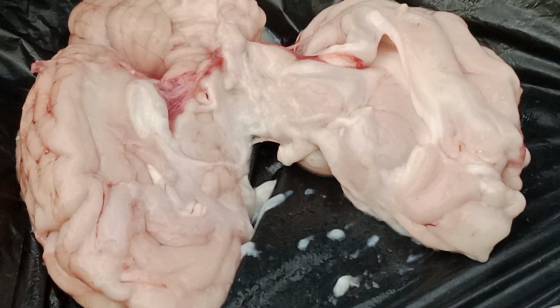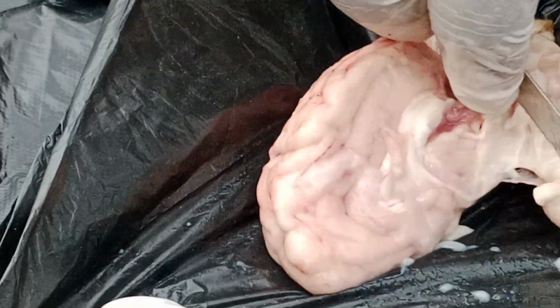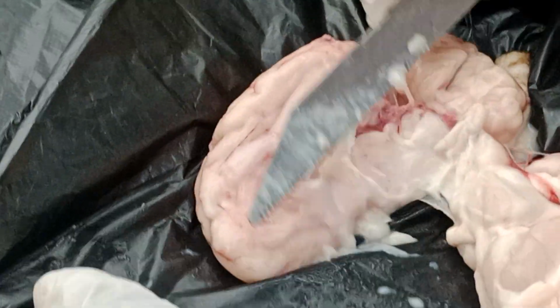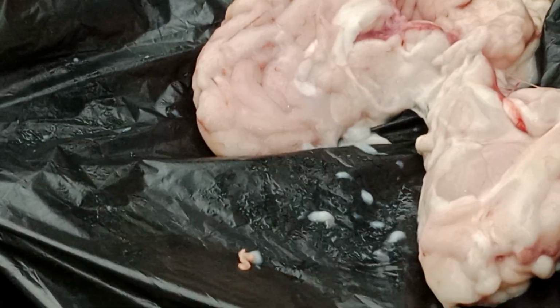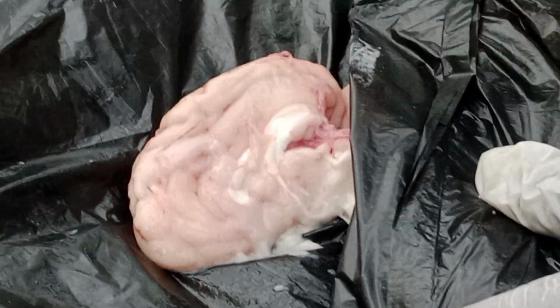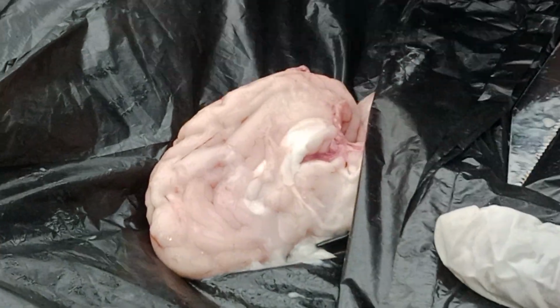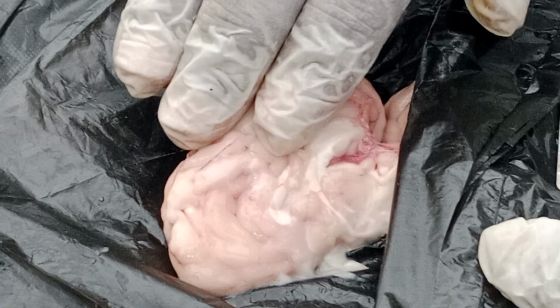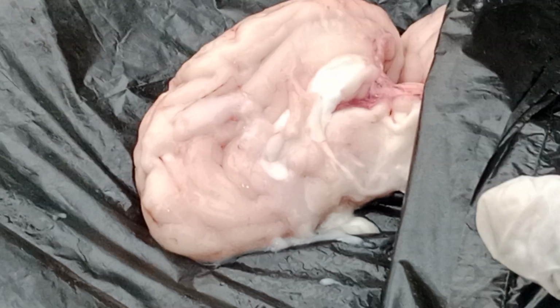See children, please observe this side only, where I am keeping the knife now. Leave out and forget about this side. It's not moving. It is sticky. Okay. I am hiding this portion for undiverted listening, so your concentration must be here only. Understand? Okay children, this is the right hemisphere alone.